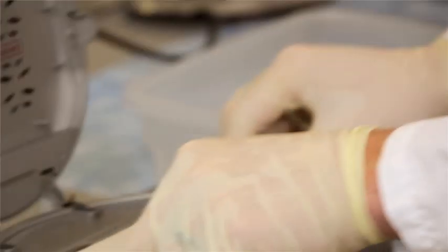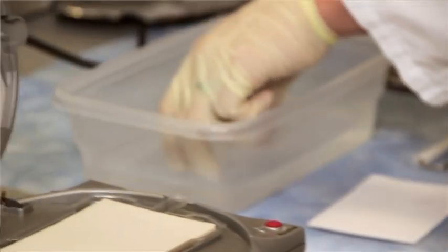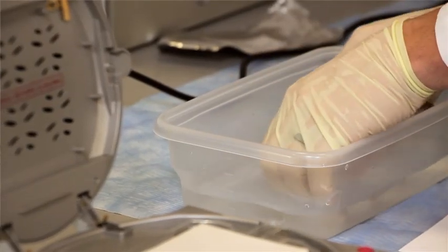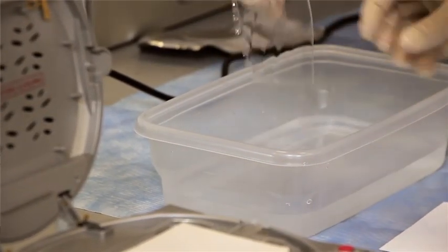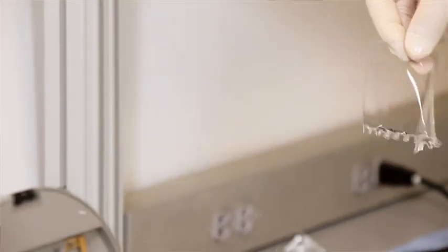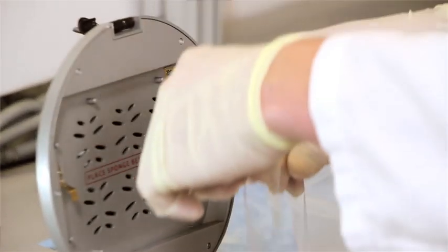Put that on the device and we've got our gel that's ready to go here. Our NuPAGE gel that I've run some purified GFP and Novex Sharp pre-stained ladder.